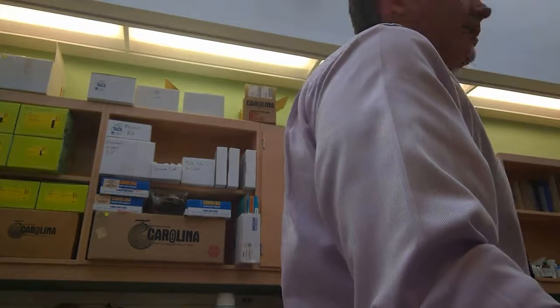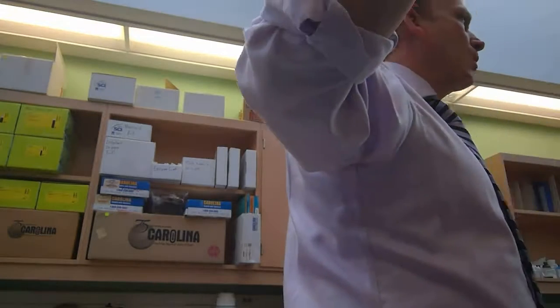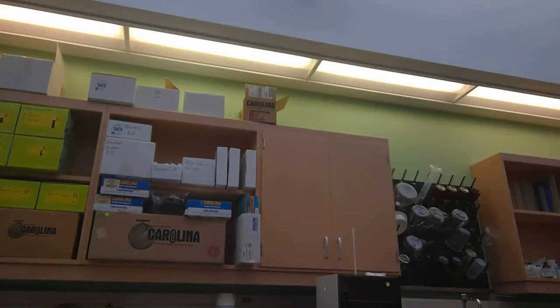Today's lab is to figure out the type of carbohydrate in an unknown carb sample, such as honey. Does anybody know what carb is in honey? But what category is sugar? Sugars can be different types. What about lactose? Powdered sugar? Wheatgrass seeds.